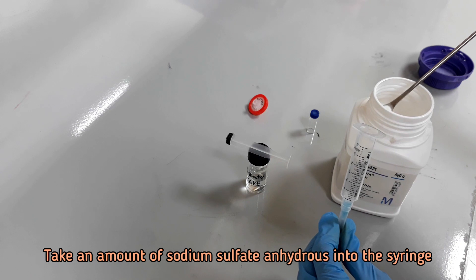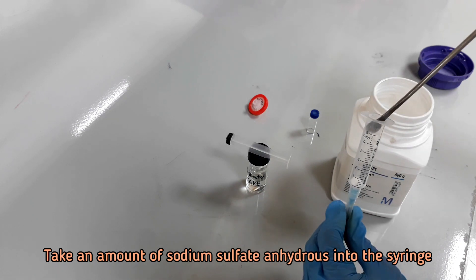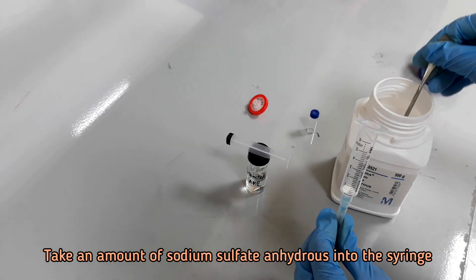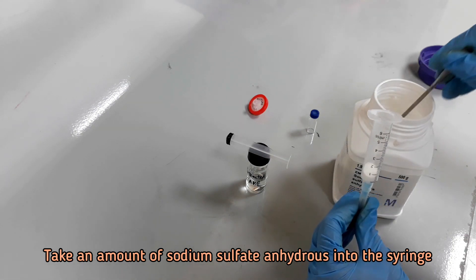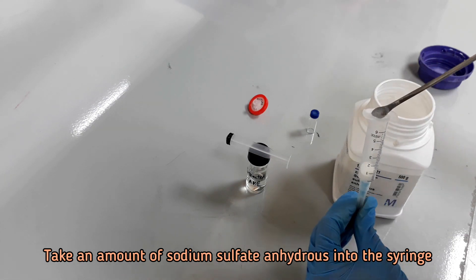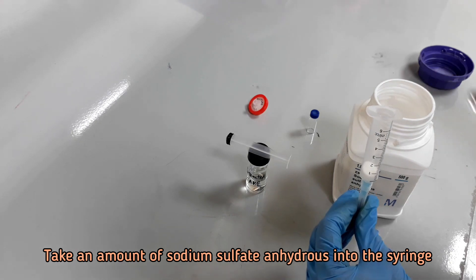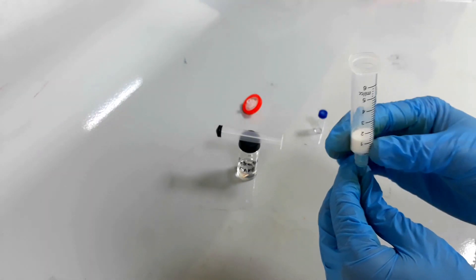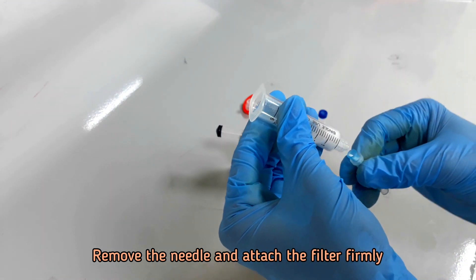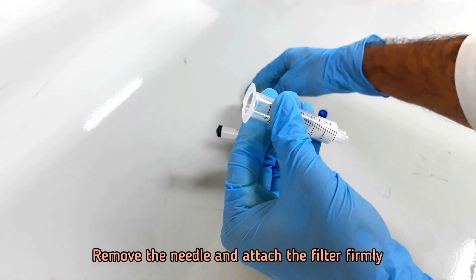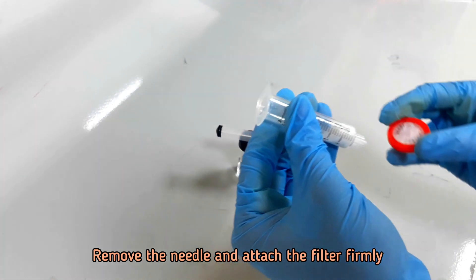Take an amount of sodium sulfate anhydrous into the syringe. Attach the filter with the syringe tightly.